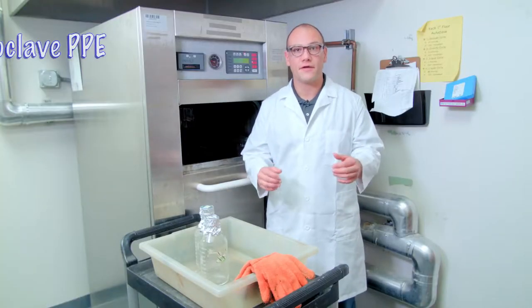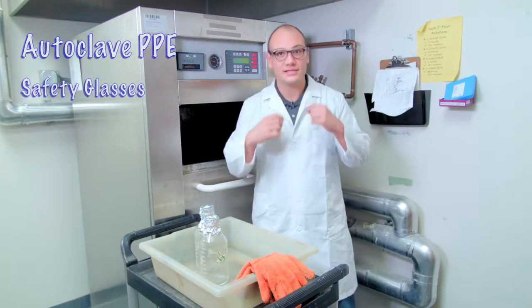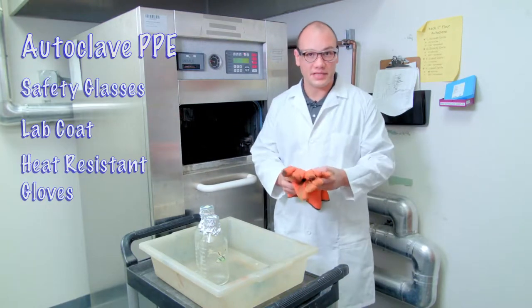Before using an autoclave make sure you're wearing all the appropriate personal protective equipment. This includes safety glasses, a lab coat, and heat resistant gloves.